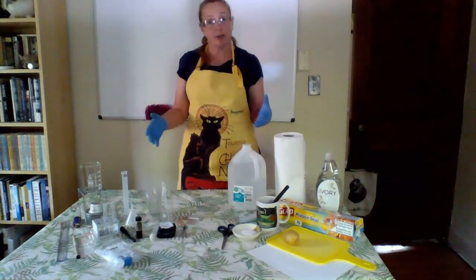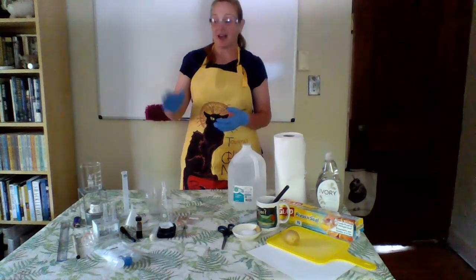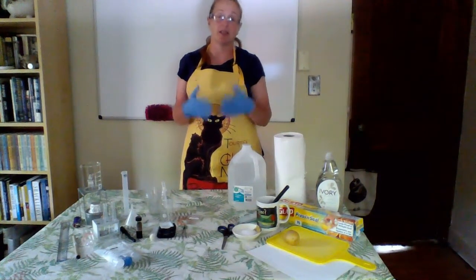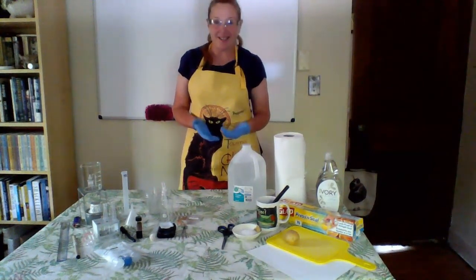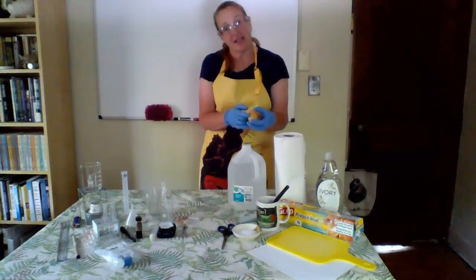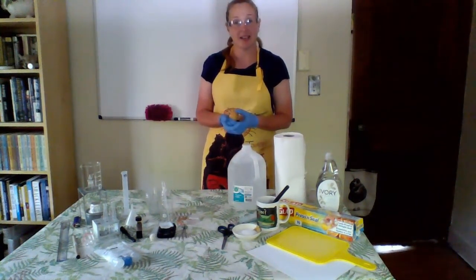So once you have all of your supplies, the first thing that we need to do for experiment 1 is set up our sugar solution. Once we have our sugar solution and we make it into different dilutions, in other words, different concentrations of sugar in different test tubes, then we're going to be cutting what essentially look like little French fries, little bits of white potato. We want to make sure that we don't get any skin when we cut our little French fries. We want that nice solid inside of our potato, and then we will be putting our potato into the treatment and then reading the results the next day.